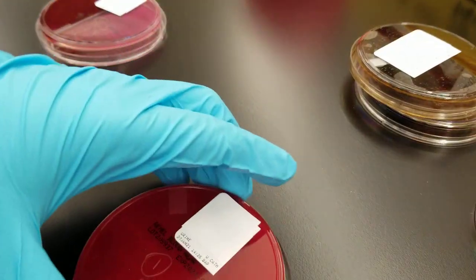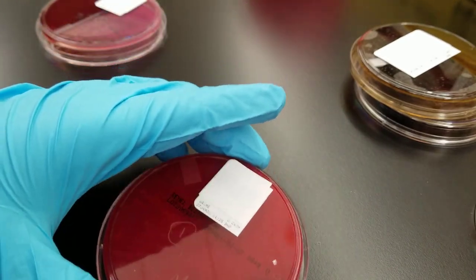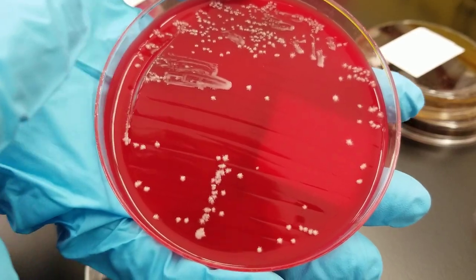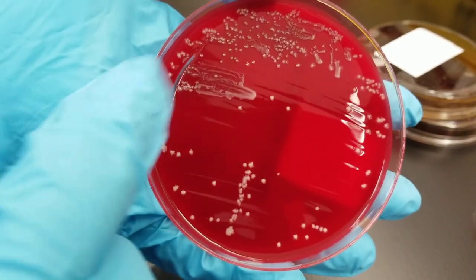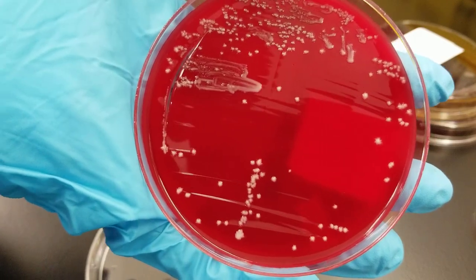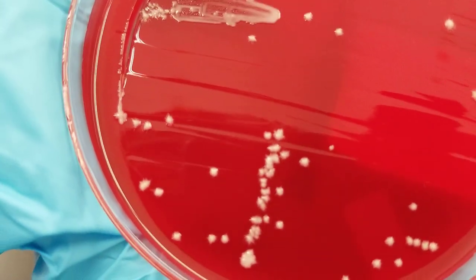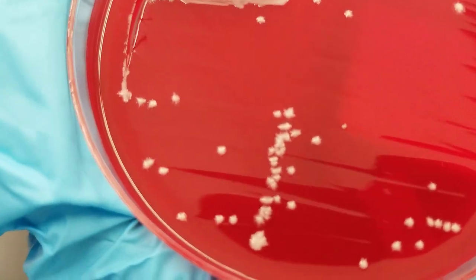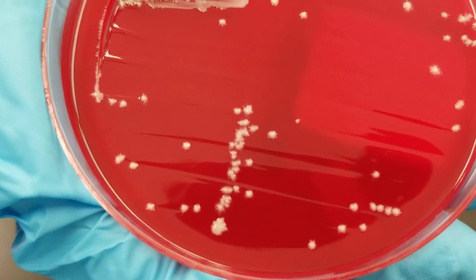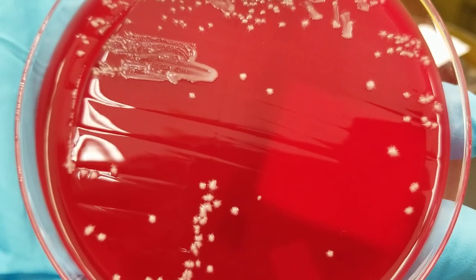Let's look at another one — this is a urine catheter as well. It looks like they took from this plate before giving it to me, so had there not been these smears, we could do a colony count. If you look very closely, does that look like normal bacteria? Do you see the little feet? That looks like yeast.